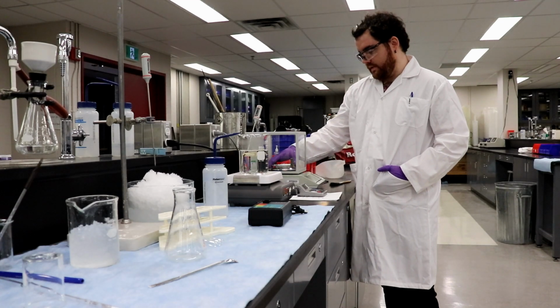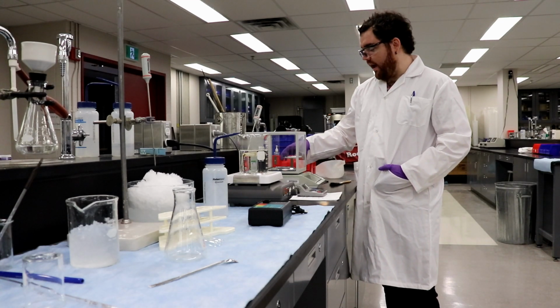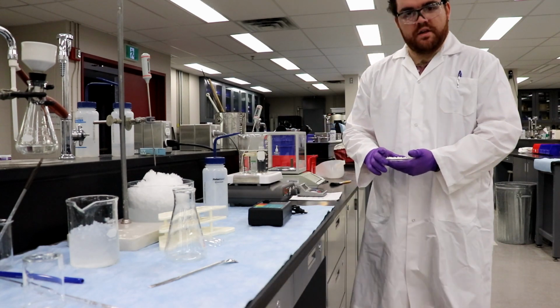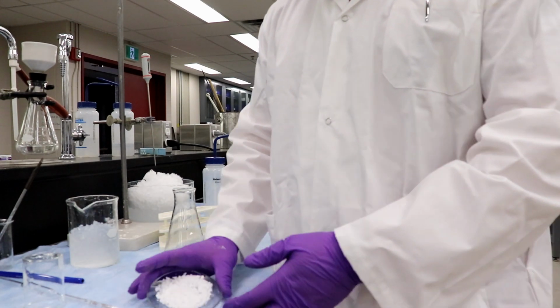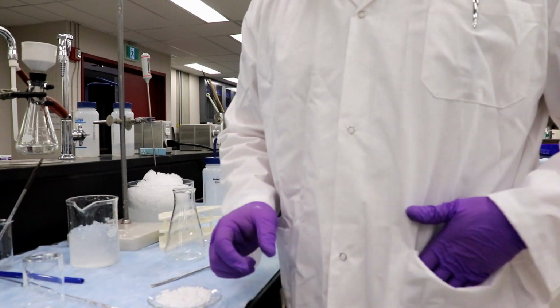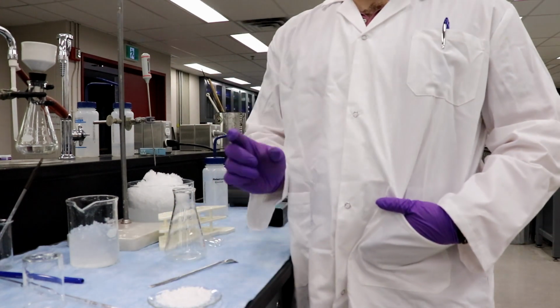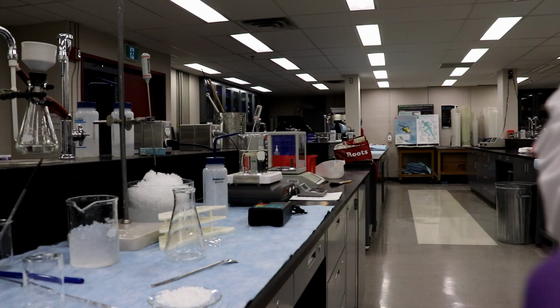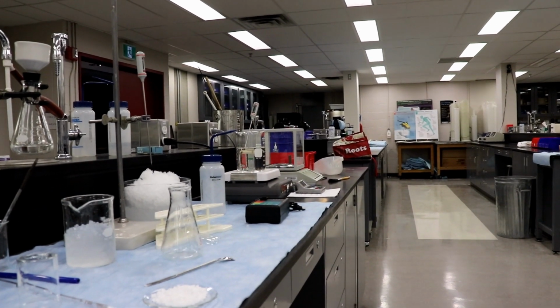Yep. Which is a lot higher than I expect, but this is still very wet. So as we dry it, we'll lose a lot of that weight. And this is where, if you're really good and keen, you'd actually figure out beforehand what your theoretical yield would be. Yeah, should have done that. Didn't. Bad, Ingrid. I know. I might actually figure it out right now.